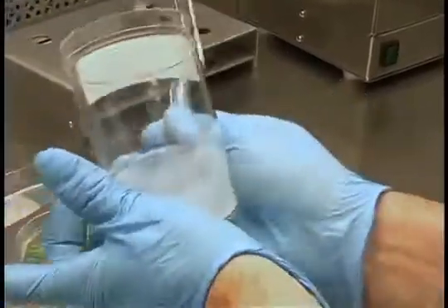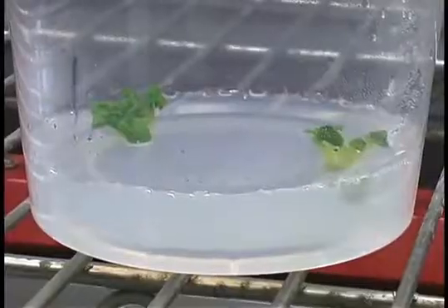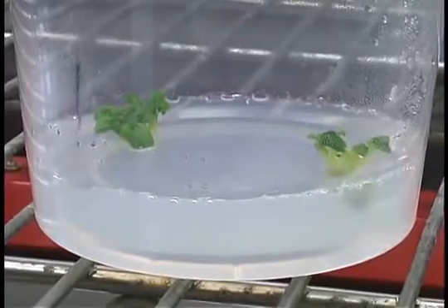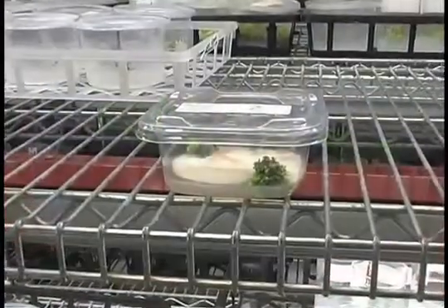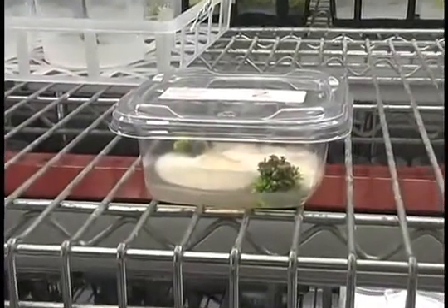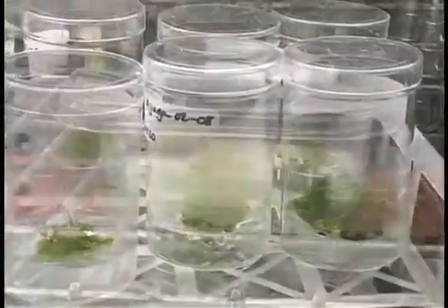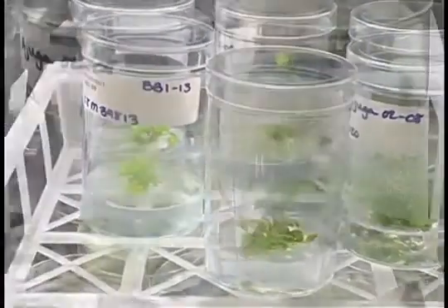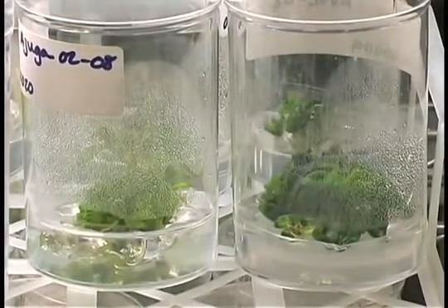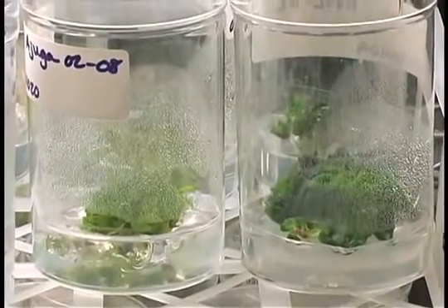In plant tissue culture, small pieces of plant tissue are placed on or in a medium rich in nutrients and sugar. If bacteria or fungi come in contact with the plant tissue or the medium, the culture becomes contaminated. The contaminants — bacteria and fungi — will use nutrients from the medium and quickly multiply and overwhelm the culture. Pathogenic contaminants will also destroy the plant tissue. Our aim is to surface sterilize the plant tissue and put it on a sterile growth medium without any bacteria or fungi getting on the plant or medium.